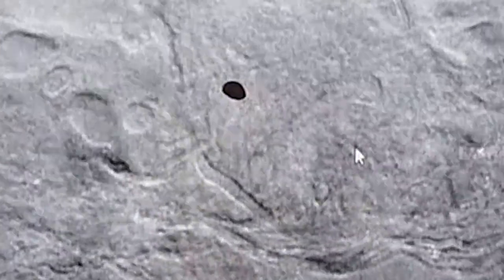As we approach, you can see that these fibers move away from the tip of the pipette, and you can really nicely distinguish the different caliber fibers close to the surface and the dorsal horn neurons in between them, with sharp, clear, well-defined contours.